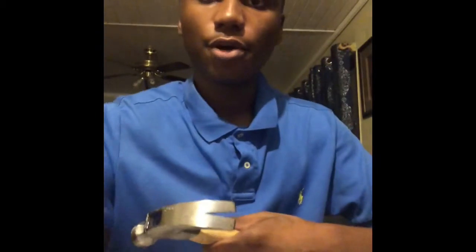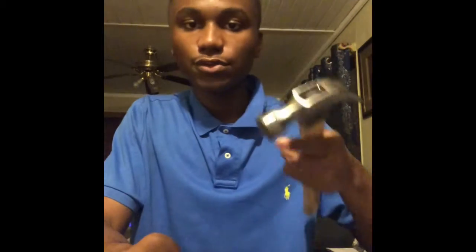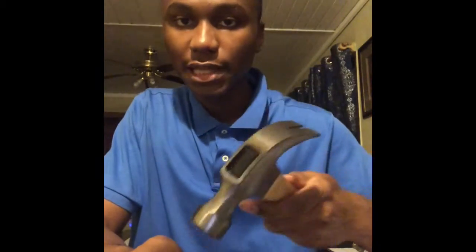Now, in this video, I'm going to be using window glass, but there are different types of glass, like tempered glass and laminated glass, but window glass for this time. First, I have my hammer and a nail, and I have my sheet of glass right here. Now I'm going to take the nail, put it in the middle of the glass, and use the hammer to apply force to break the glass.